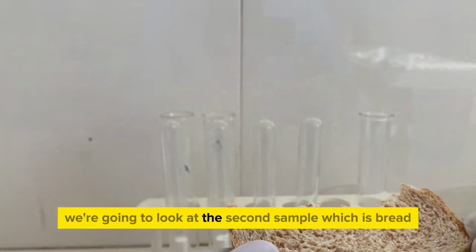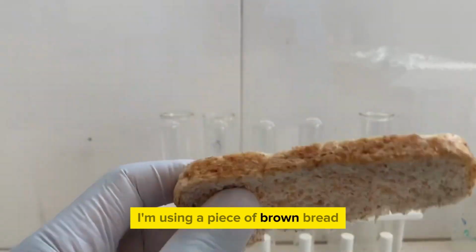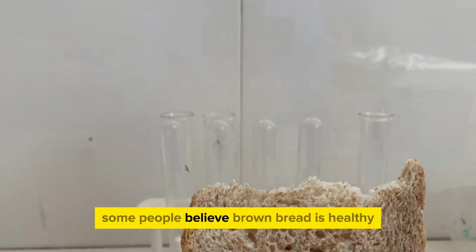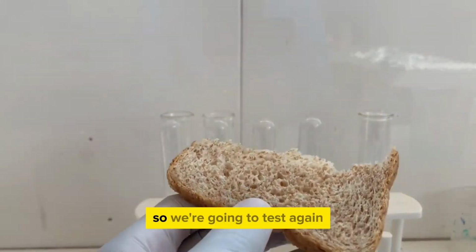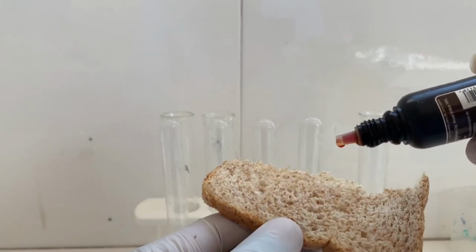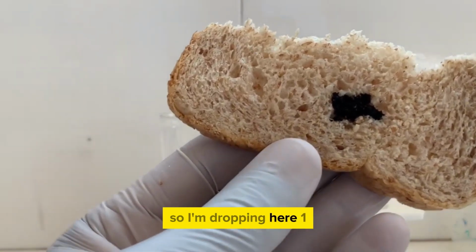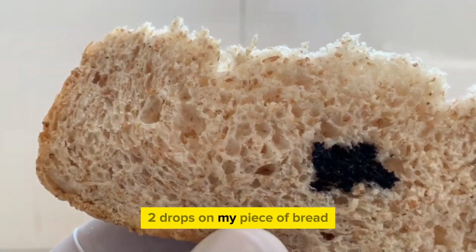We're going to look at the second sample, which is bread. I'm using here a piece of brown bread. Some people believe brown bread is healthy, so we're going to test again for the presence of starch in our piece of bread. So I'm dropping here 1-2 drops on my piece of bread.